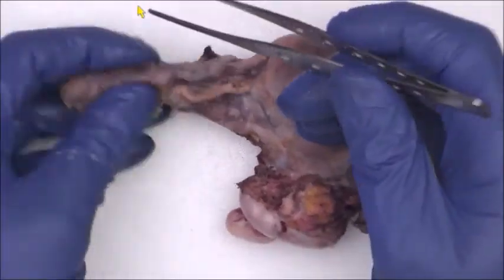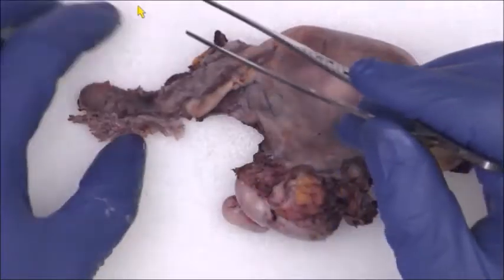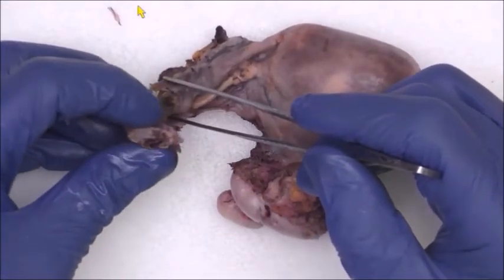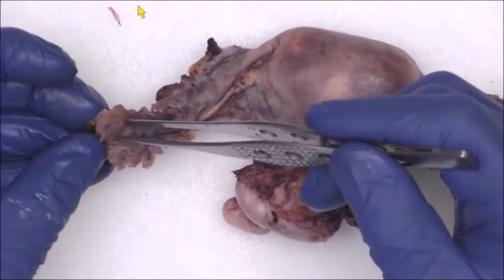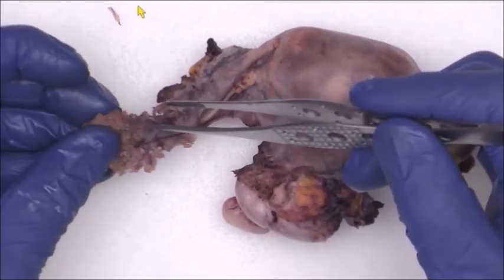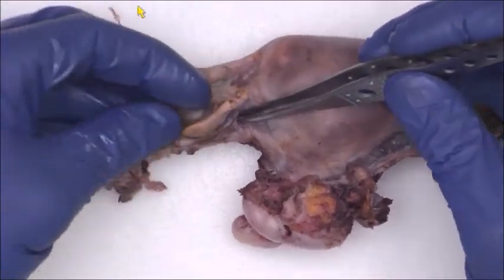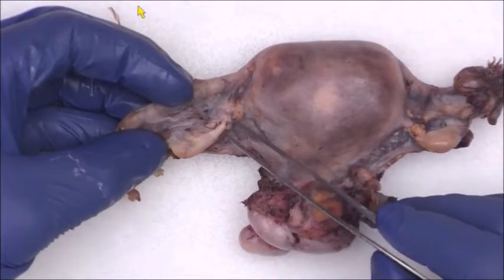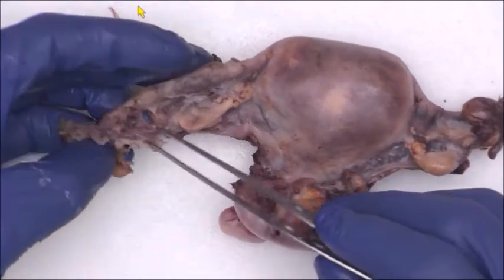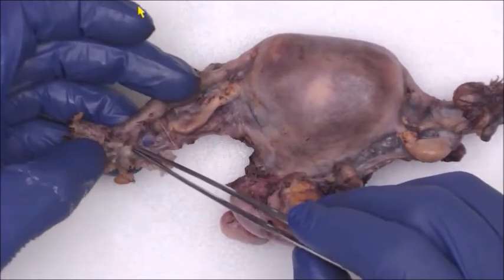We've got the fallopian tube here, fimbria here. I can kind of palpate either a peritubal cyst or a dilated portion of the tube here. We'll investigate that shortly. We've got the left ovary here with excrescences here, here, and here. Looks like there's probably an excrescence here and some little scattered adhesions here and here.